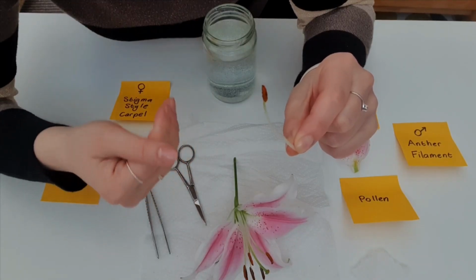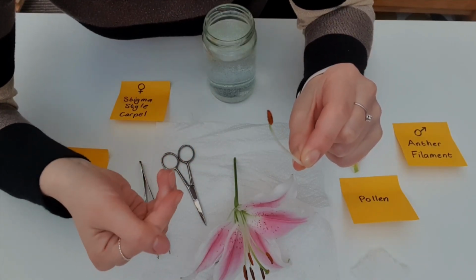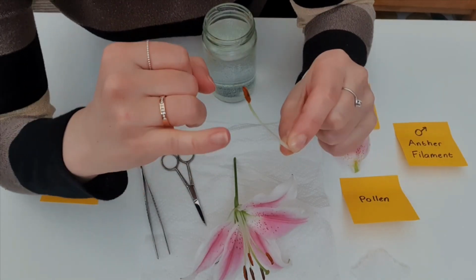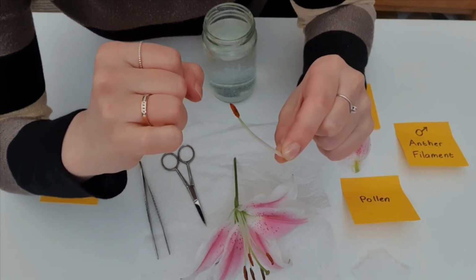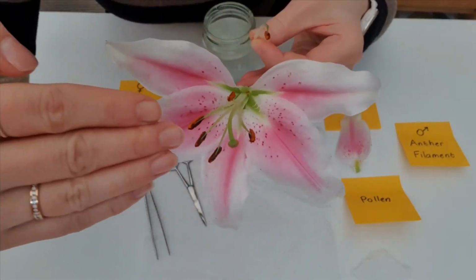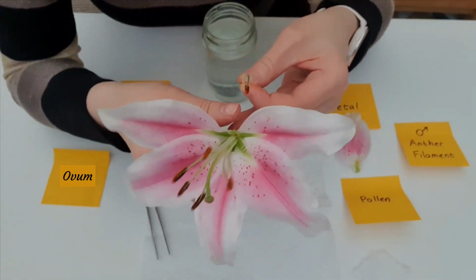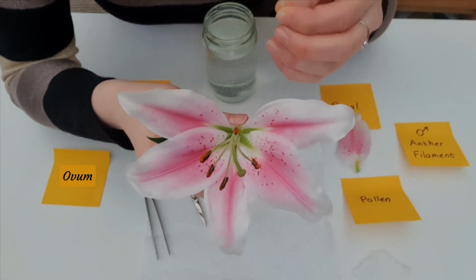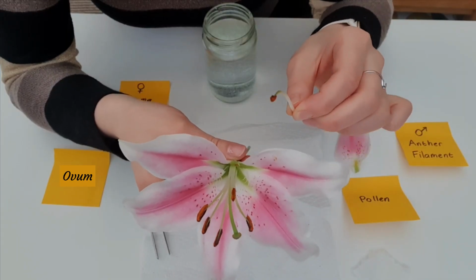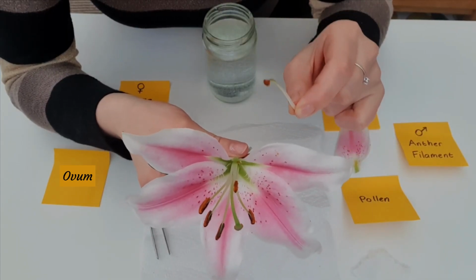Okay, remember the flower is the reproductive organ of a flowering plant, because not all plants flower. And this here is what the insects will make contact with once they go down into the centre of the flower. Now, of course, they're not interested in the pollen. The pollen is just rubbed off on their backs as they go in to find the nectar that they're interested in.